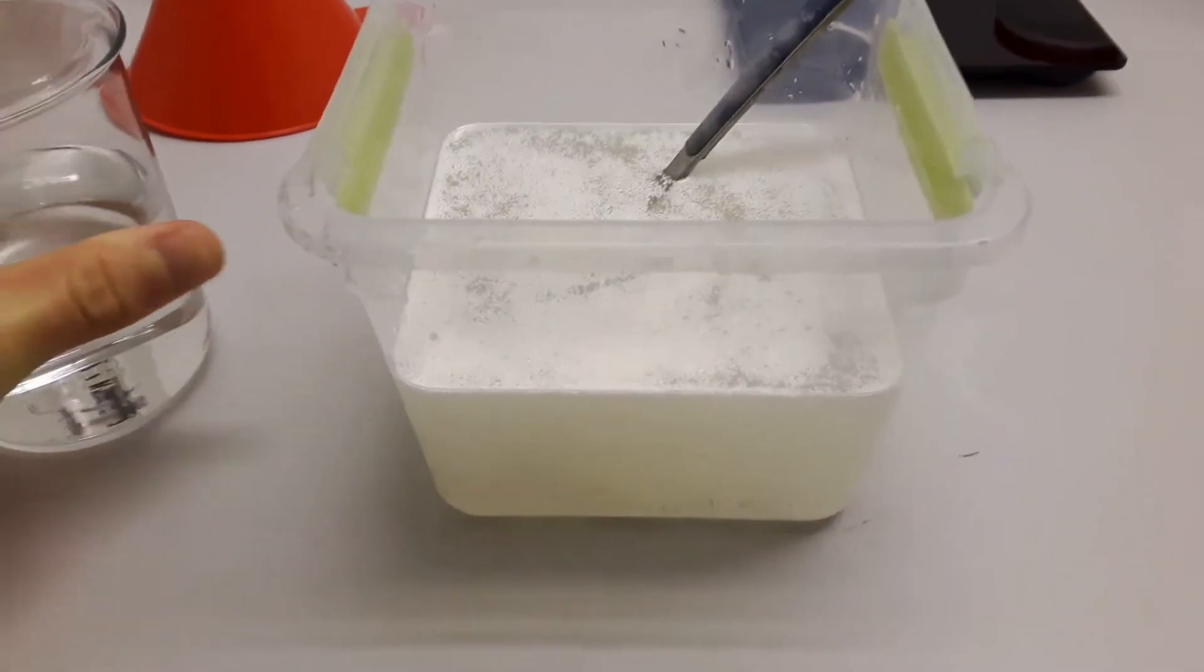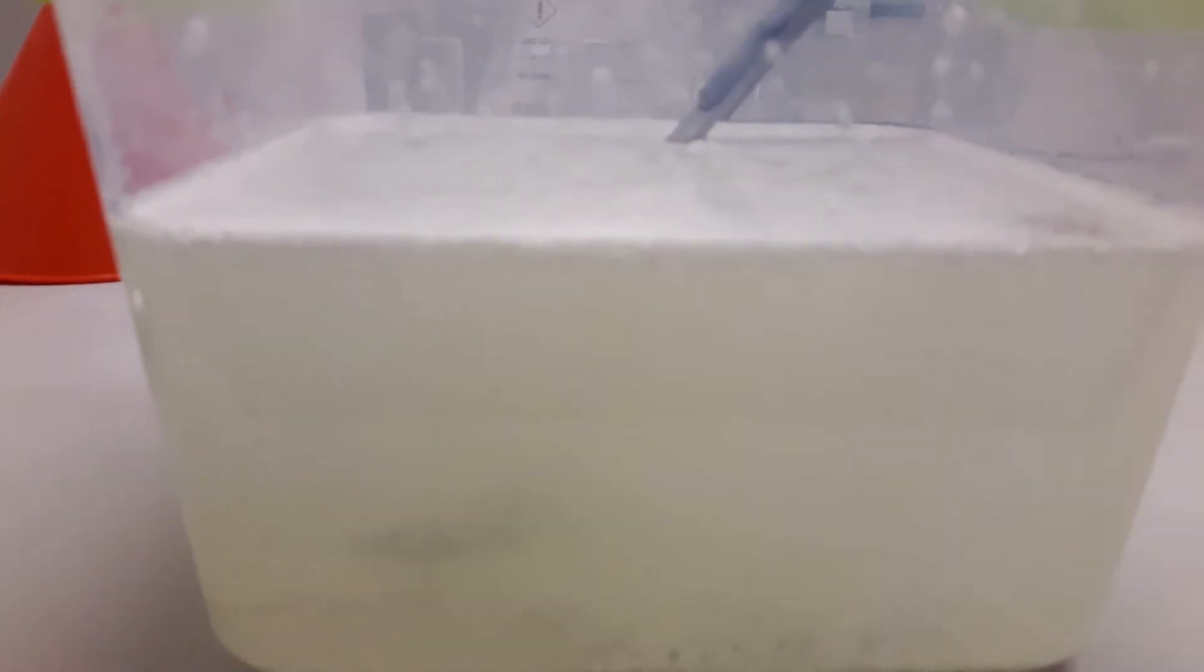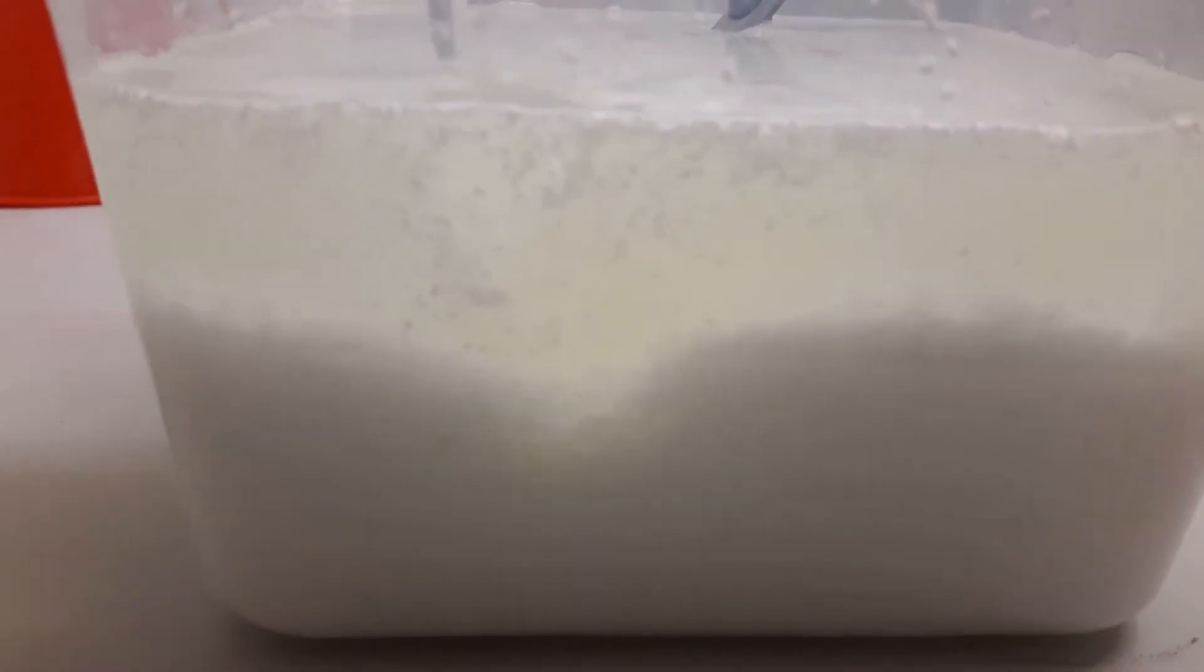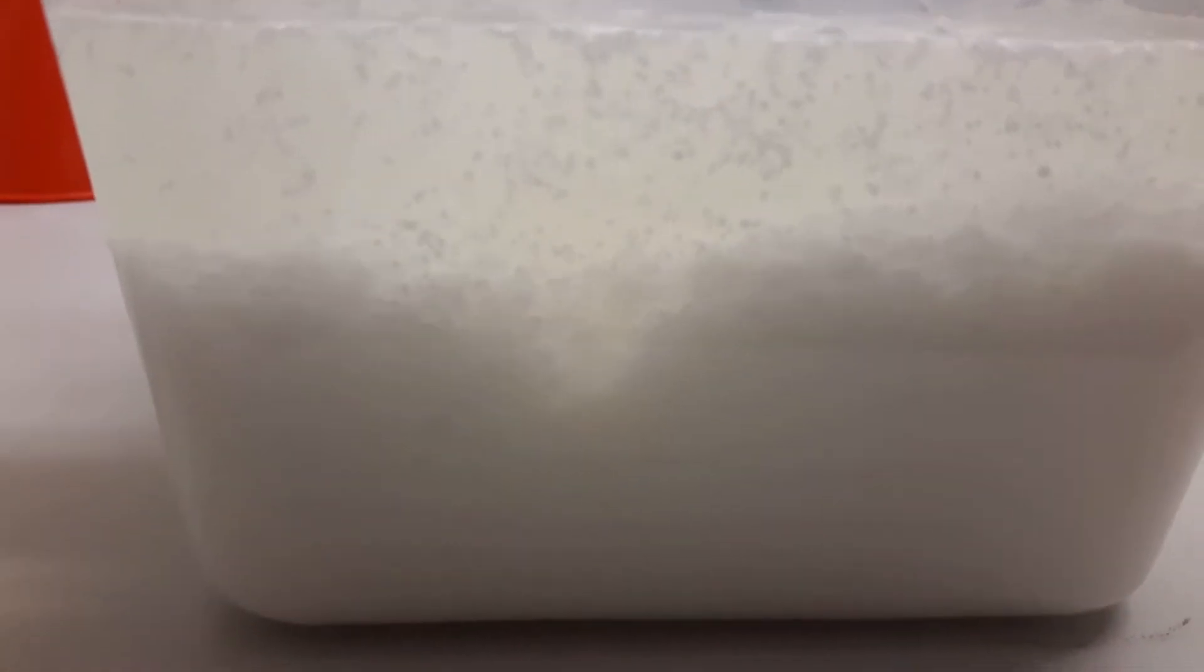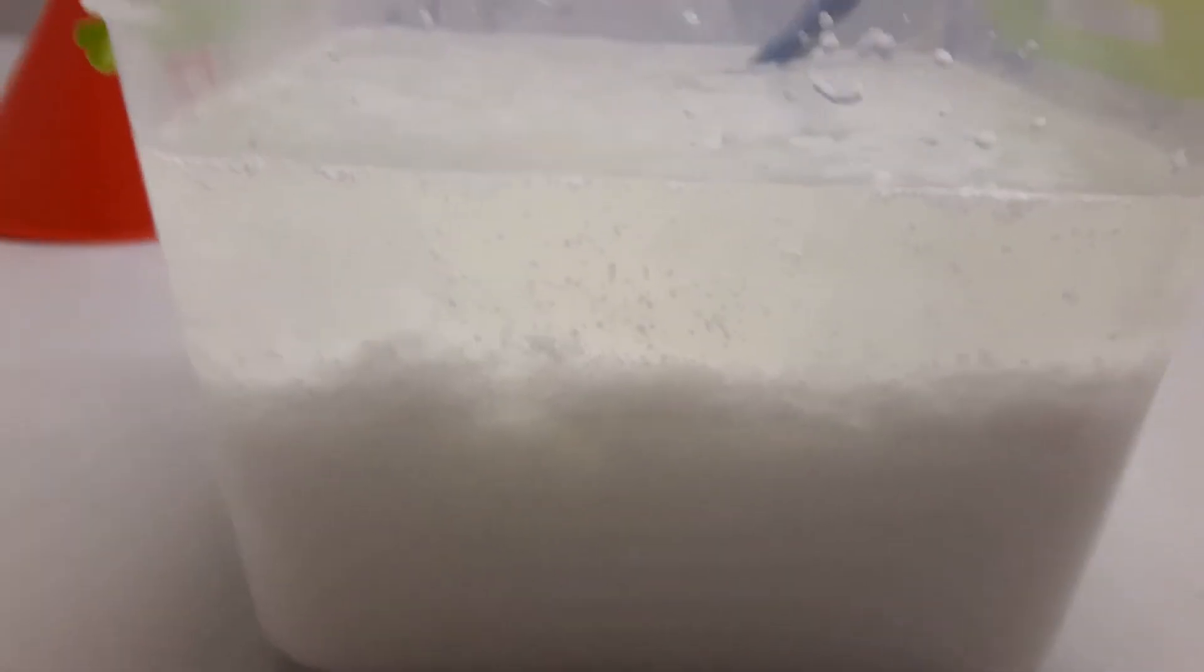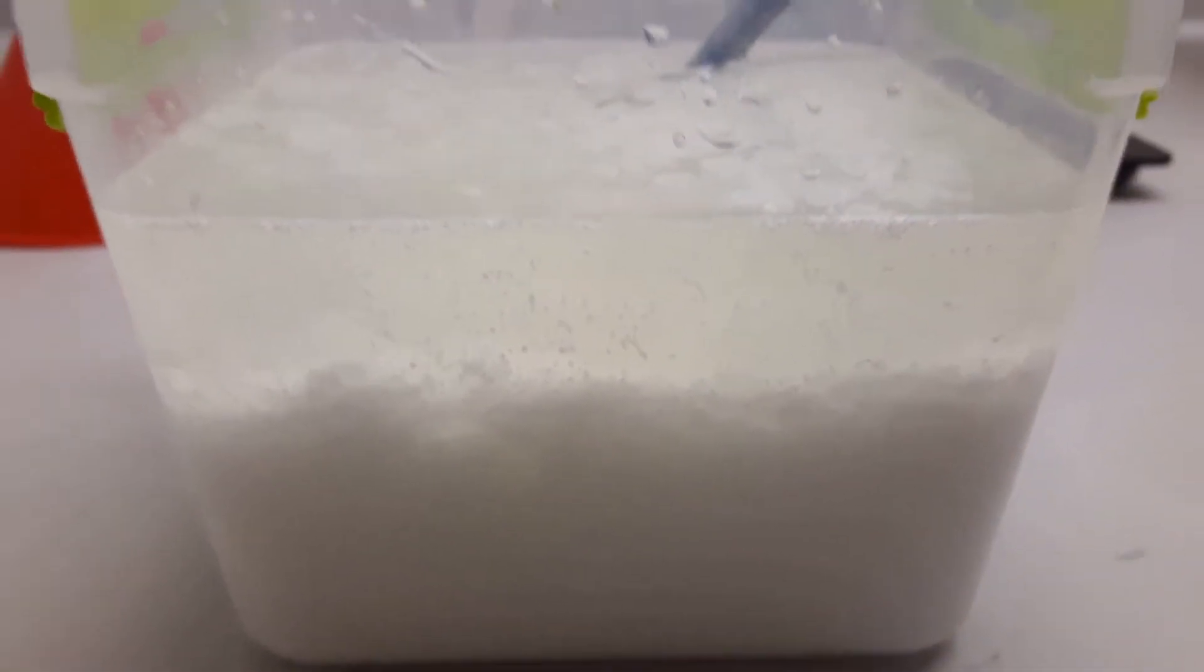Now we have a pretty nice solution and add the sulfuric acid. You can see the benzoic acid is not very soluble in water. You will see it flaking out, producing this white precipitate that fills up the entire bottom. It looks like there's not that much, but once you stir it you get a pretty nice slurry that stinks horribly.